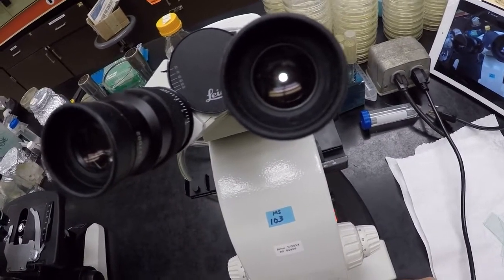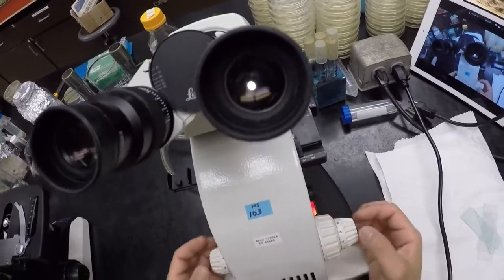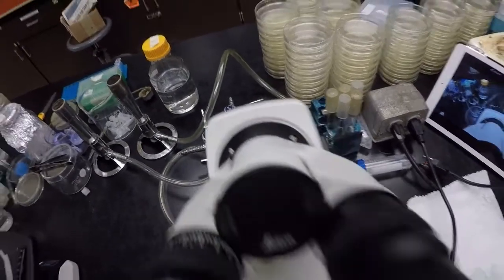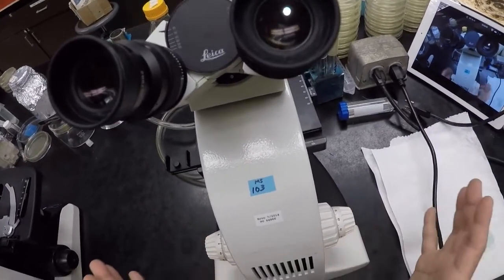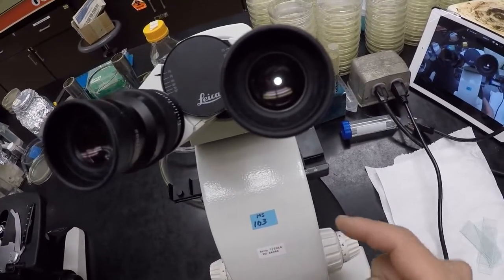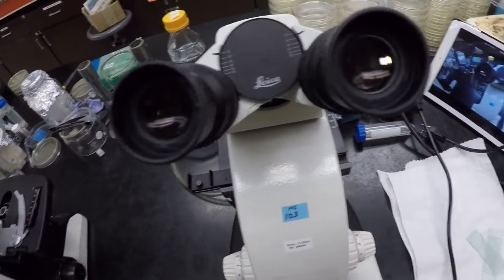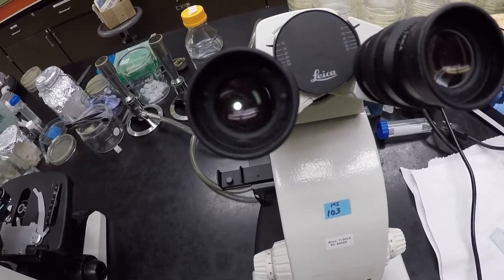Okay, so once you are in focus using the coarse focus, then use the fine focus and sharpen the image. I'm going to just go double check that. Good. And then sharpen the image until it's nice and clear. Okay, so that's good. Now we are in focus under the 4 times. What we're looking at there is 4 times 10, 40 times larger than it is in real life. Okay, good. But that's for bacteria, it's going to be super tiny, so we want to move in closer.